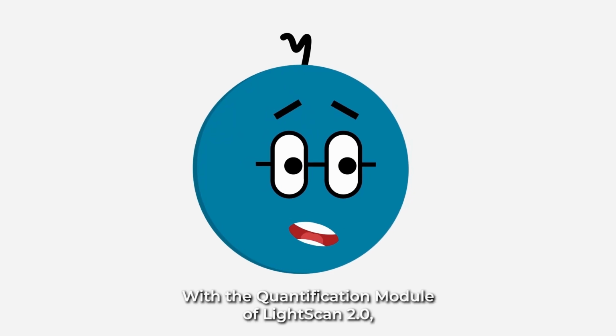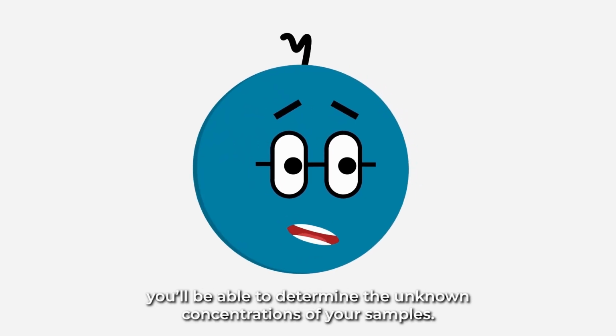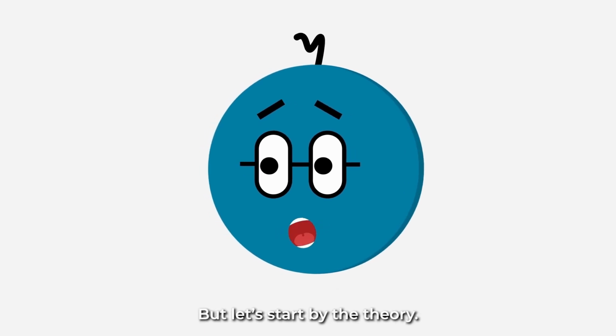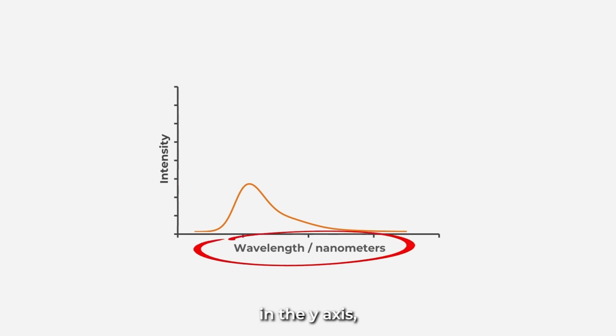With the Quantification Module of LightScan 2, you'll be able to determine the unknown concentrations of your samples. But let's start with the theory. In any spectra, you'll have the information of intensity on the y-axis per wavelength on the x-axis.